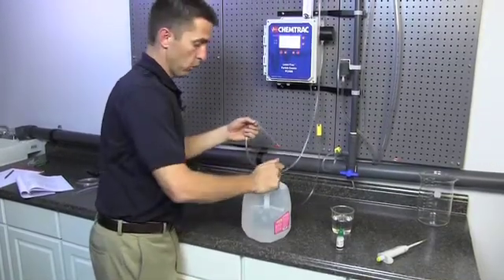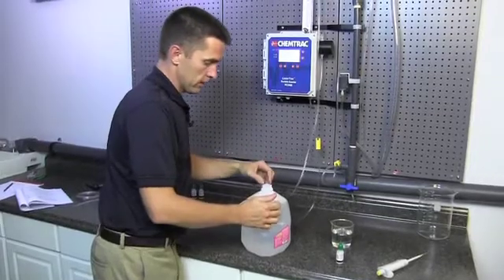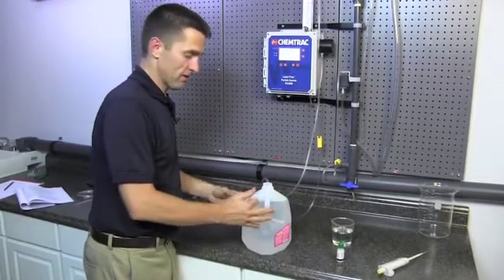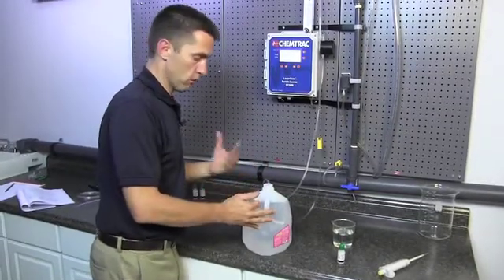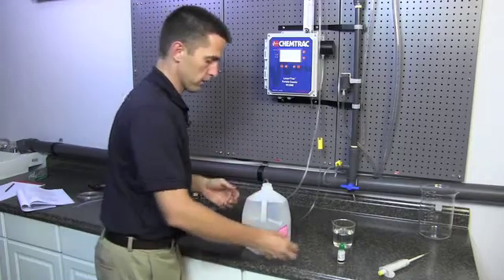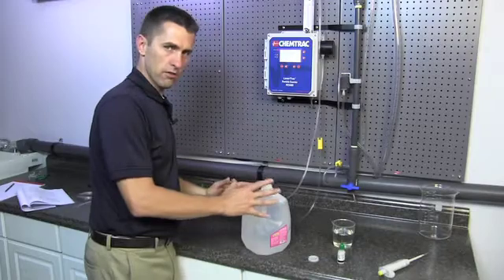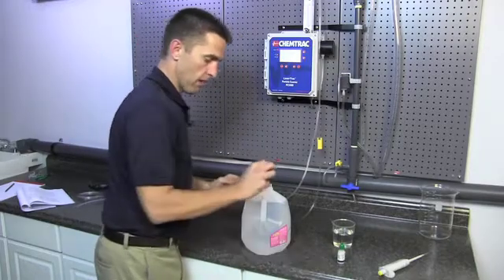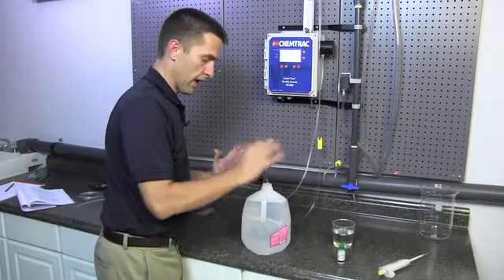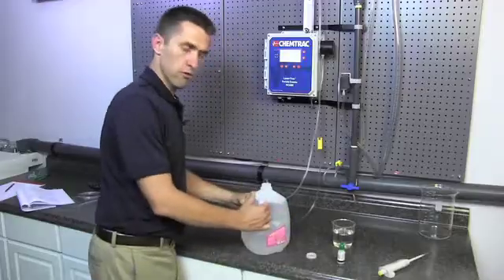The spheres will stay suspended for a very long time. The jug doesn't need continuous mixing. These two micron spheres stay in suspension for a long time. But occasionally if you do let it sit there for say more than five or ten minutes, it's not a bad idea to put the top back on and then once again kind of agitate the jug to re-disperse the spheres.